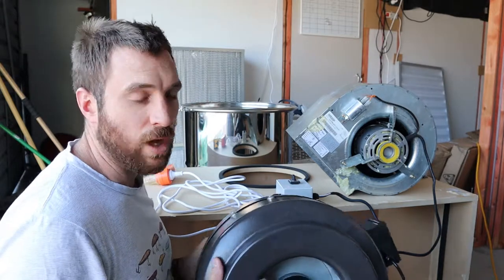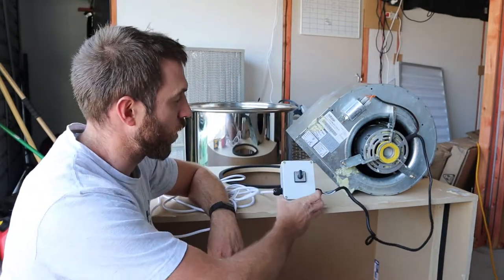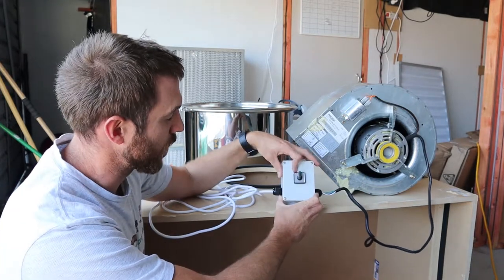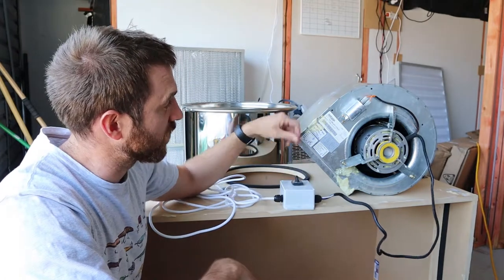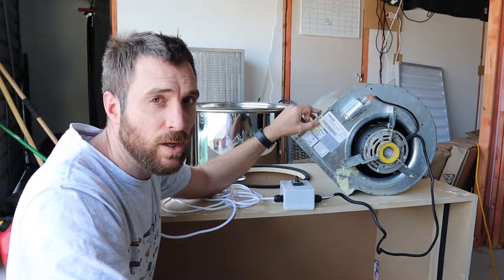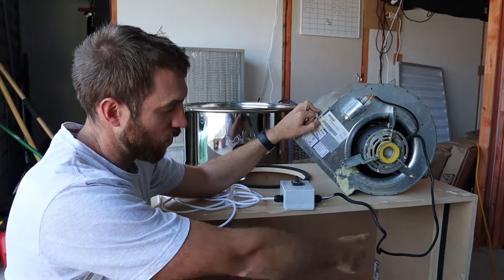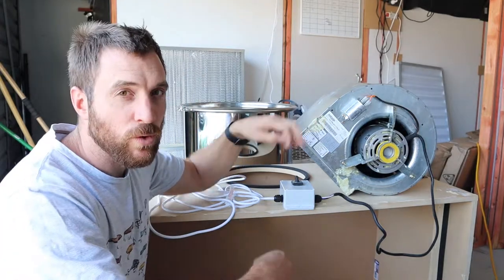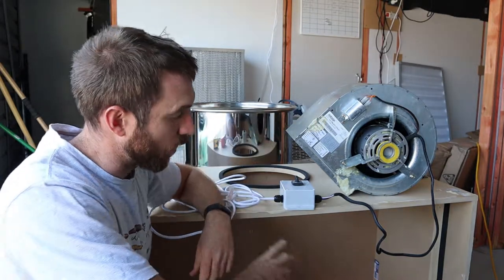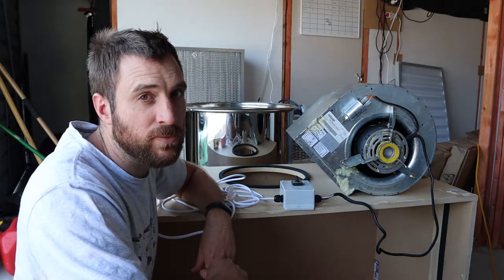So this is the new one here, which I've wired up today. I've got a wire box here, which has got two positions, a 1 and 2 speed. The fan itself is wired for 3 speeds. Now I'm just using the 1st and 2nd speed. I've done the calculations on the area of my flow hood and the volume of air going in for how quick the air will come out, and low speed is pretty much perfect.